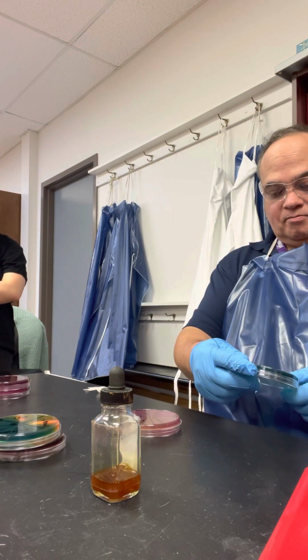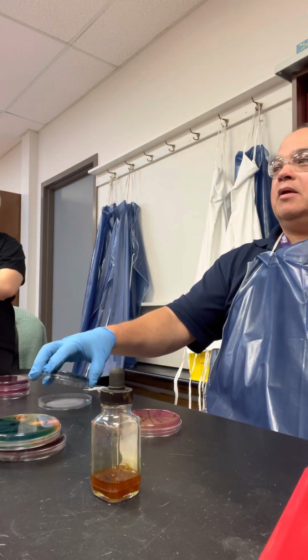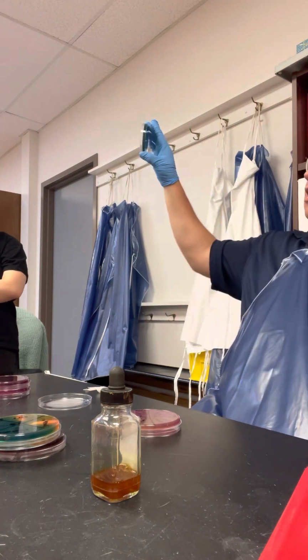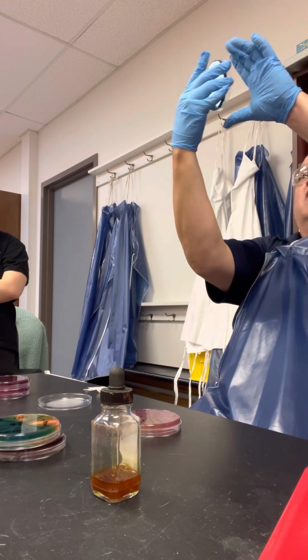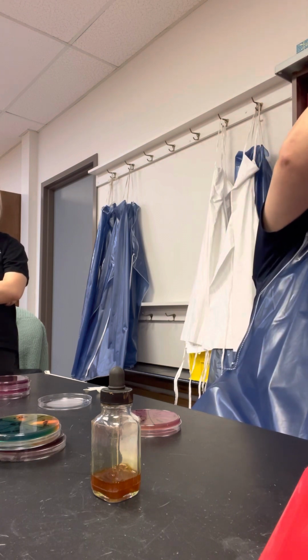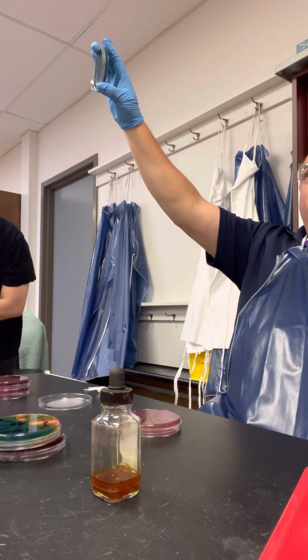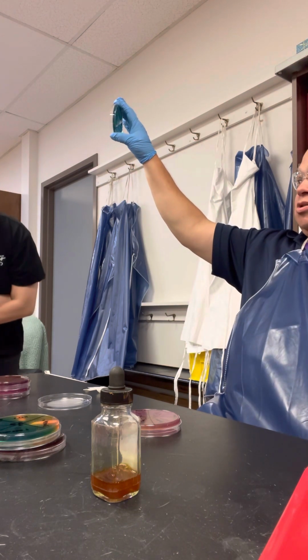Oh, and by the way, who did this one? Does it say on the top? I think it's Fatima. Fatima did the most beautiful streak I've seen in a long time. And you can see, first of all, that it's blue-green, and then you can see that there's black precipitate in it. She isolated her colonies, she did a beautiful job. This is an A plate right here. Good job. Just gorgeous. One point for everyone?